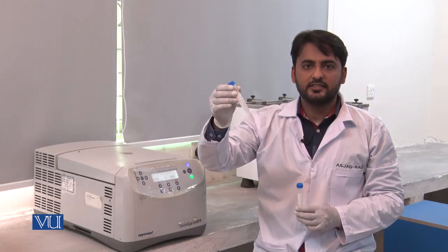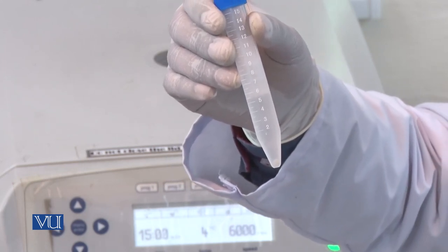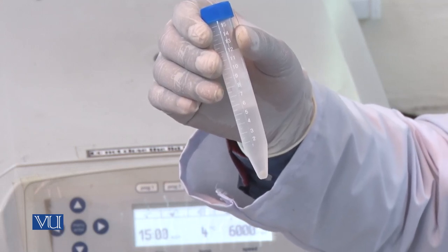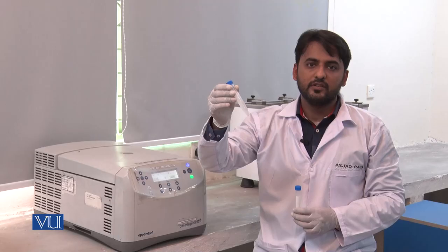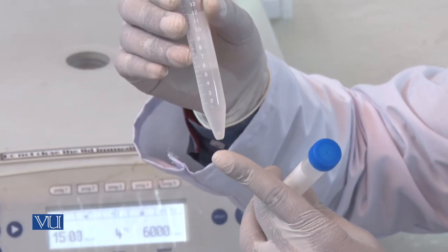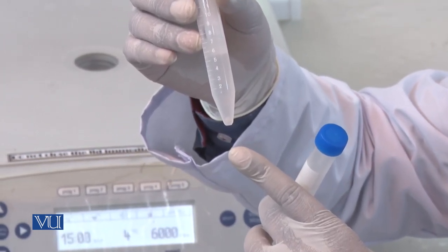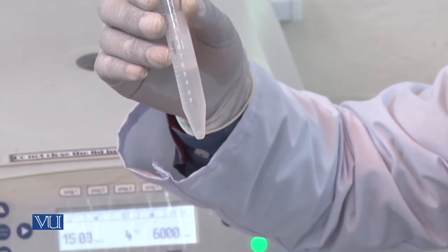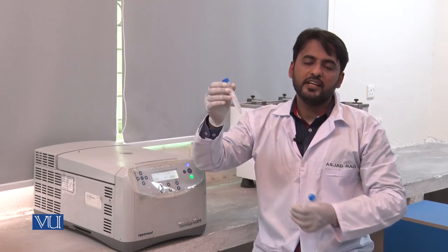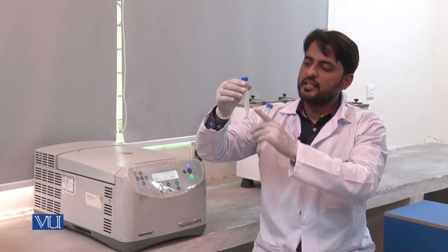Let's discuss the results. Here in this tube, you can see at the bottom there is a white milky colour pellet. As I mentioned at the beginning of the experiment, there are two types of enzymes — one is extracellular and the second one is intracellular. At the bottom you can see there is a pellet. In the case of intracellular enzyme, the enzyme will be present in the pellet at the bottom of this tube, whereas in the case of extracellular enzyme, the enzyme will be in the supernatant.